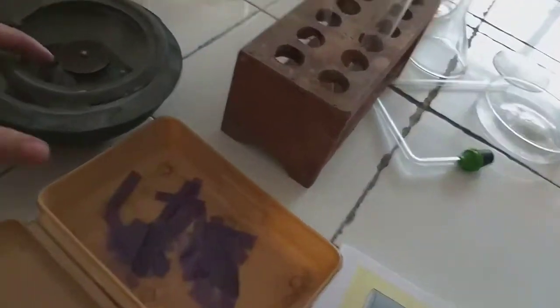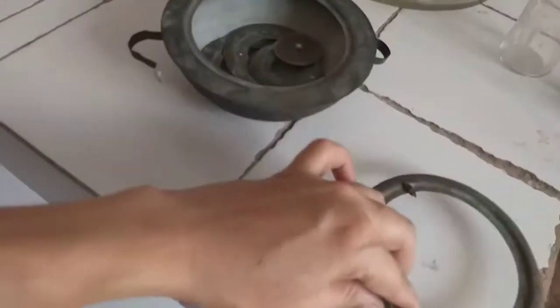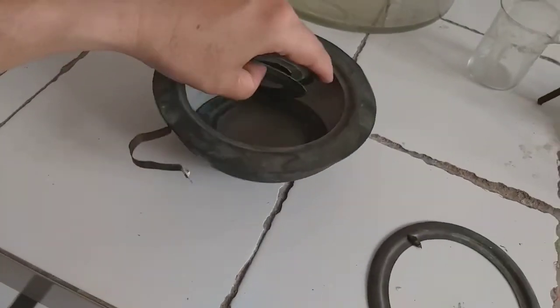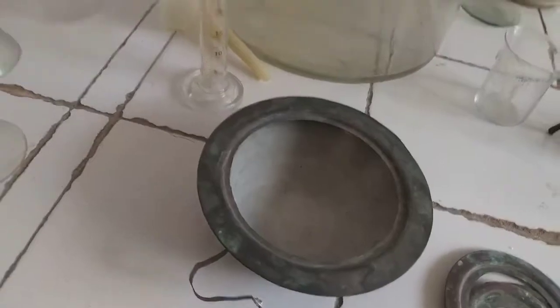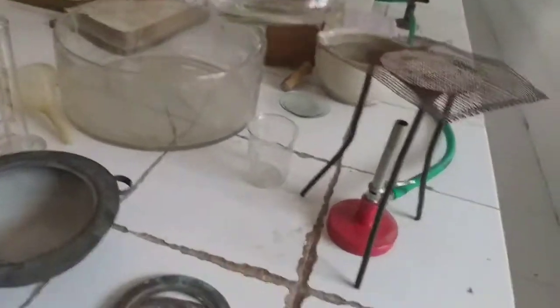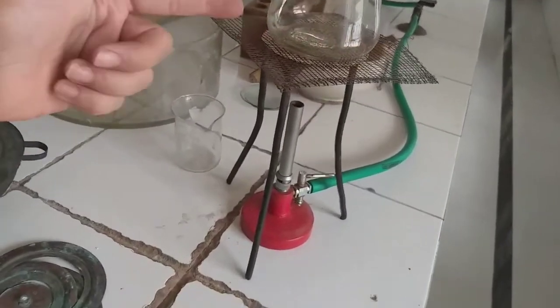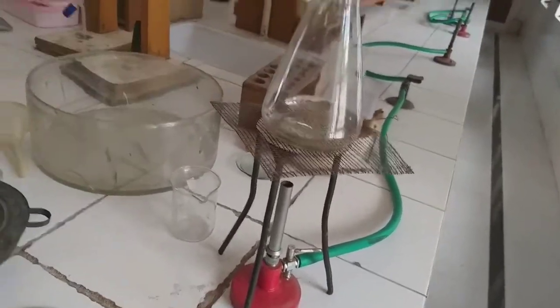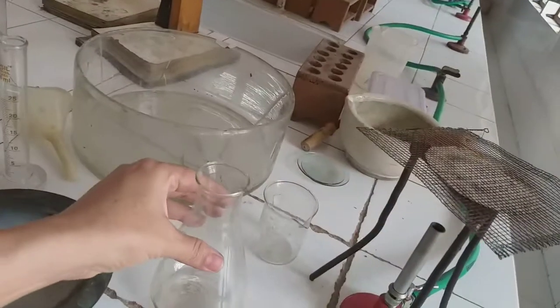Now we have this another container over here. This is called a water bath. Now there are many times there are chemicals which we cannot heat directly. Okay, supposing there is some chemical which might be very volatile and might vaporize on heating directly. Okay, we do it at home also many times. So what we do is we heat it indirectly.